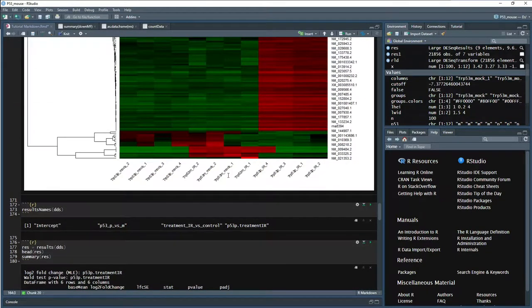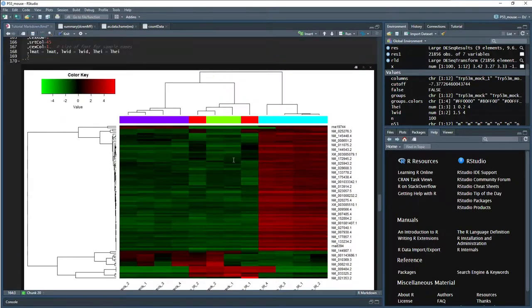And that is important if you are interested in knitting. So if we go up here we can do knit, we can knit to HTML or knit to PDF. If it's not of interest to knit and have those documents like a report, then having that error there isn't too big of a deal.